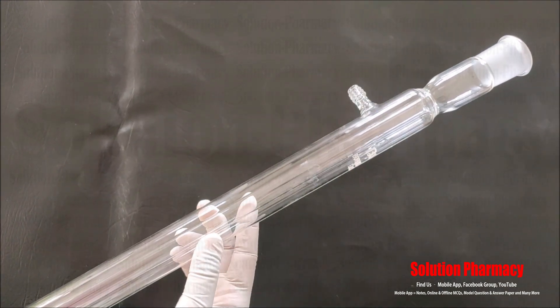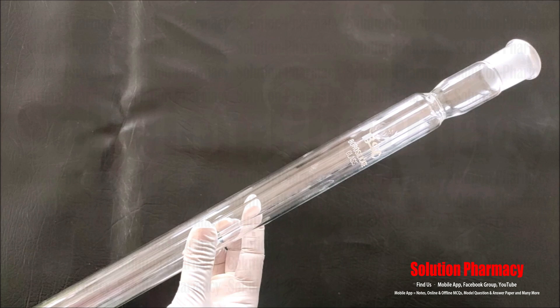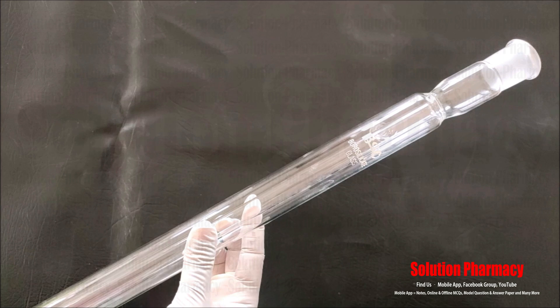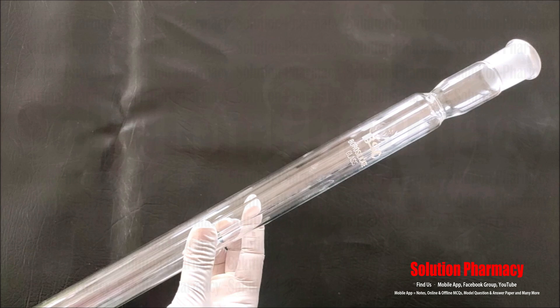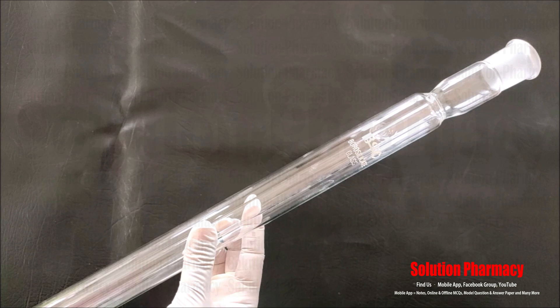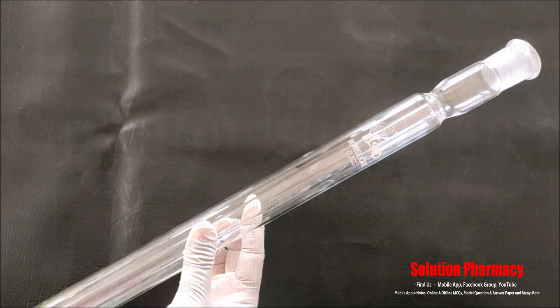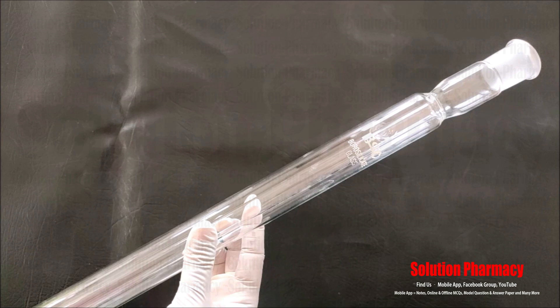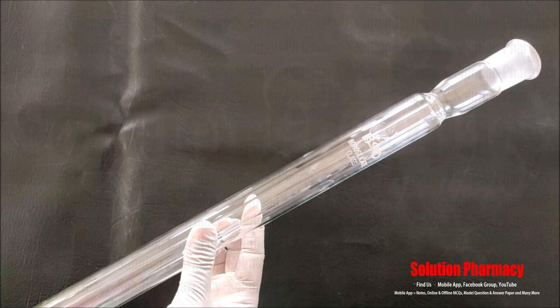Next, this glassware is called a condenser. It is used generally for distillation of water or volatile oils — when we boil a liquid, it evaporates into vapor, then condenses back into liquid form in this condenser, and is collected in another container. The condenser is also used for reflux — when we need to boil a liquid mixture for a long time, we fit this condenser to a round bottom flask to prevent solvent loss. The evaporated solvent goes to the condenser and condenses back into the flask drop by drop.